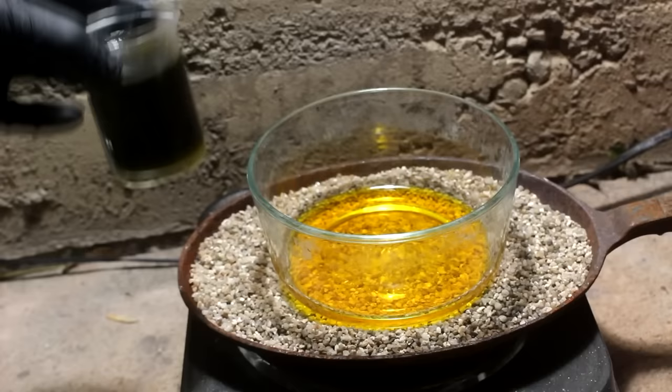Let's put this little bead of palladium on the scale — just over half a gram. That's rather pitiful, but there it is. Managed to recover the palladium out of those teeth. So out of 25 grams of teeth, we got 15 and a half grams worth of precious metals — not including the silver. I imagine the silver was the bulk of the rest of it. There's the pieces in better lighting — you can see the gold and the palladium. It's rather pretty, made from teeth.